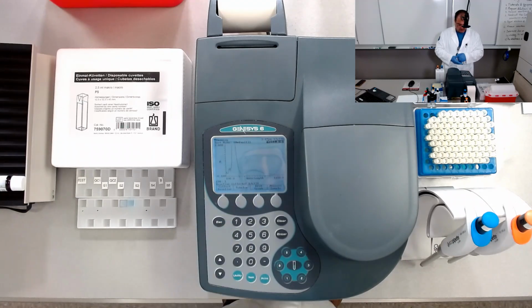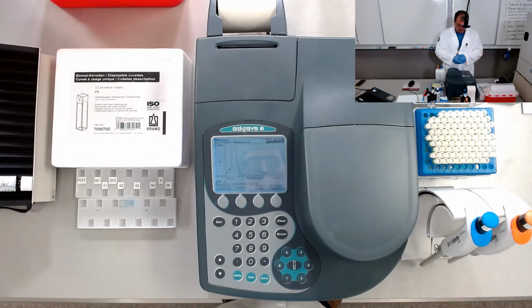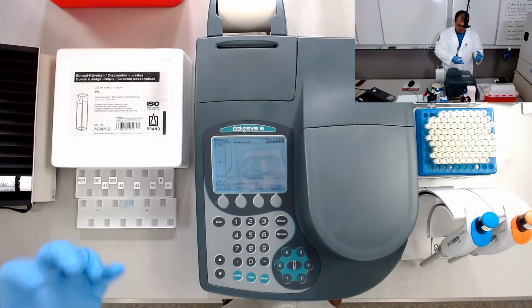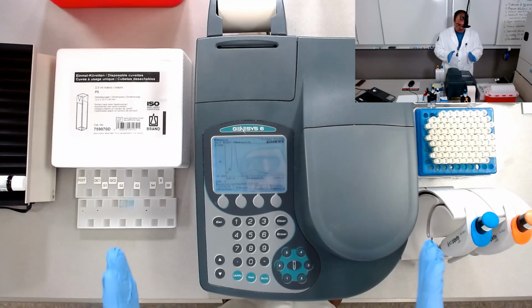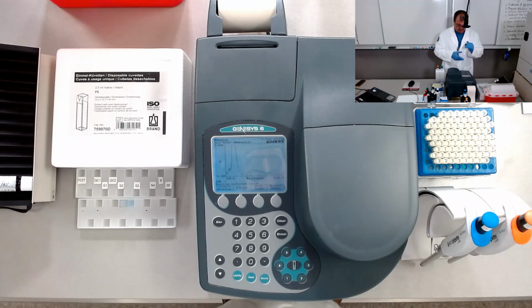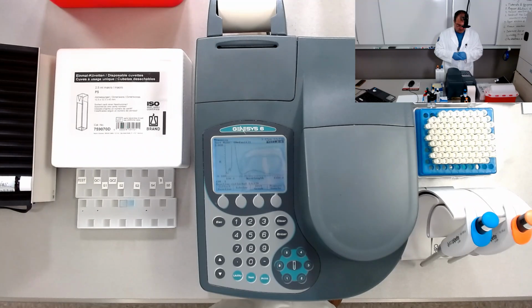So this is the absorption spectrum for this sample, which is total protein reagent in serum used for control, in a proportion 1 to 50. So 50 parts of total protein reagent and 1 part of serum.